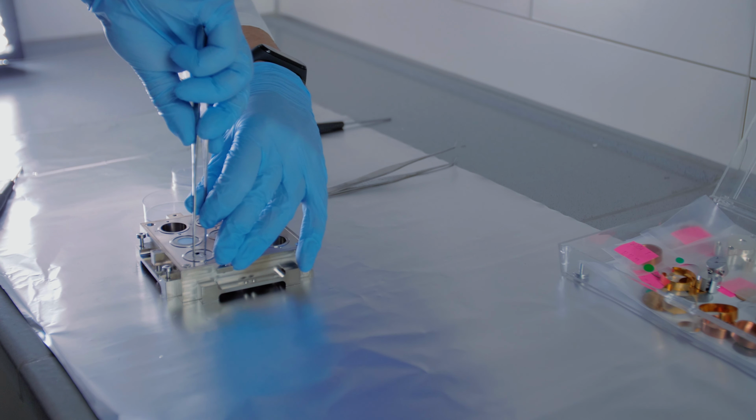Coatings are of increased importance for many industrial products for reasons of decoration as well as stability. There is a technological challenge caused by the various substrates used, because different classes of material are applied as coatings and because many products are reshaped after the coating step. Crater formation and adhesion problems are therefore among the most common analysis requests.